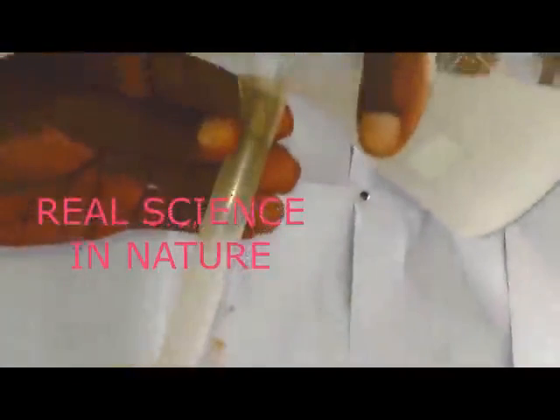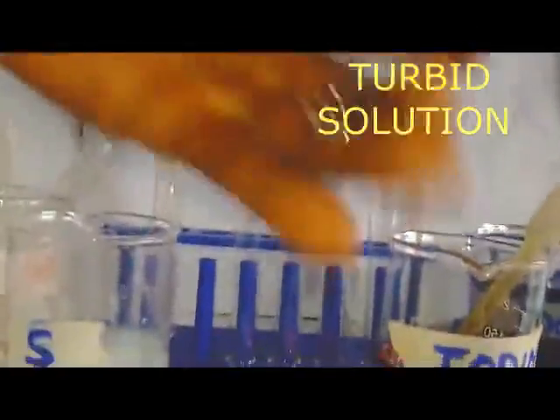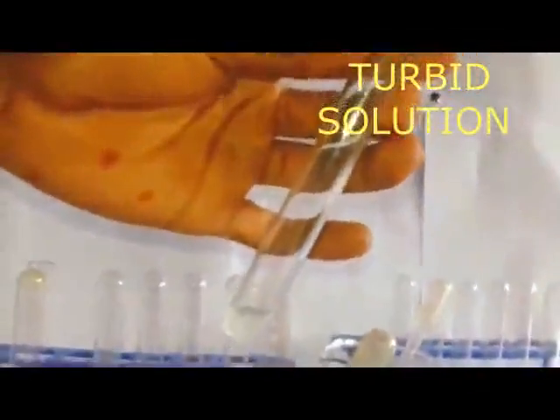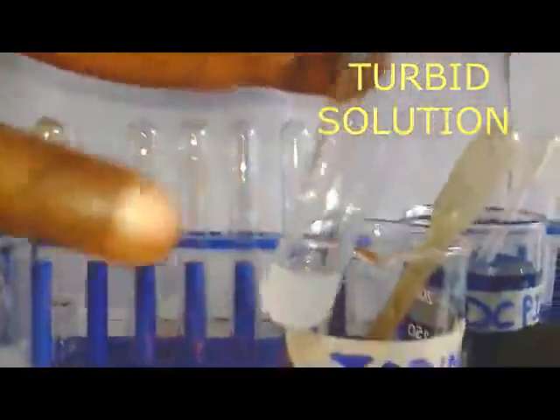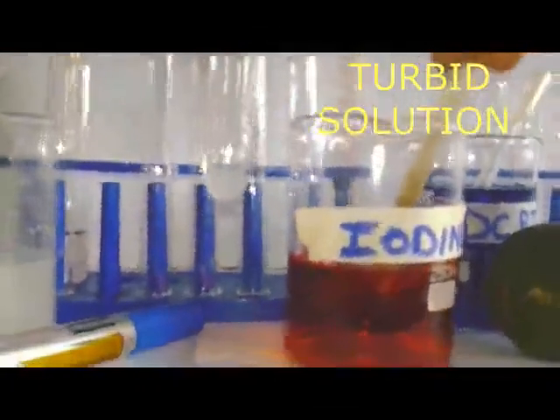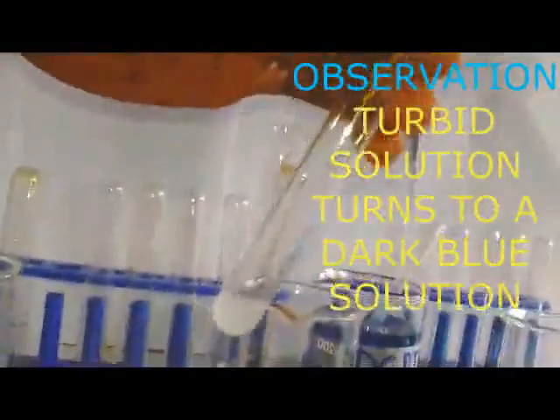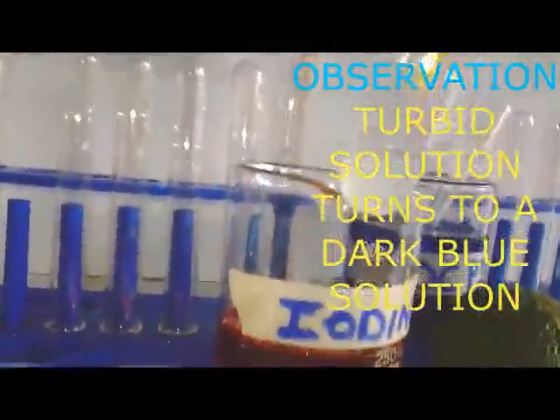You can even use the 4 cubic centimeters. It depends. If, for example, I take my measurement there as my 1 cubic centimeter, then I get my test tube, remembering to hold the test tube properly, as I always tell you. So you put your solution in. After putting in our turbid solution, we are going to move to the reagent. Our reagent is here. Don't forget our reagent. This is our reagent, iodine, brown. Then we get our brown iodine and slowly put in drop by drop.